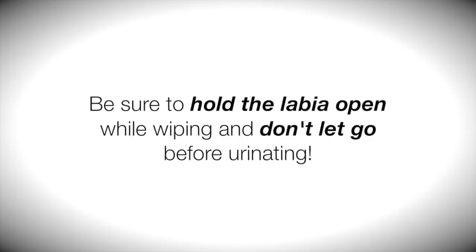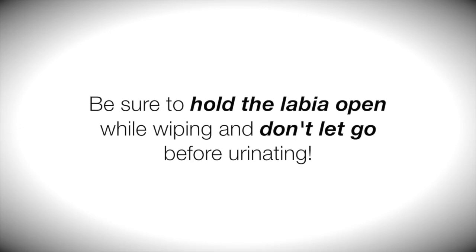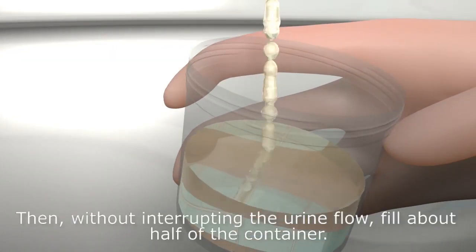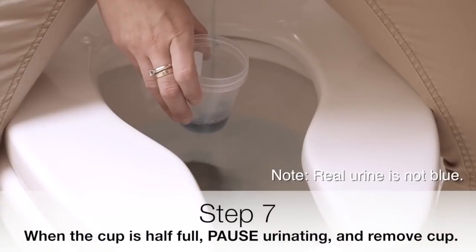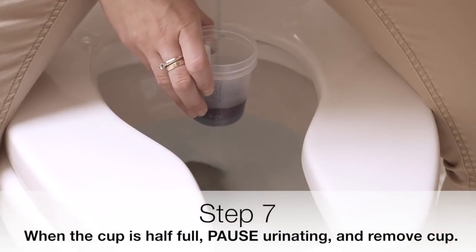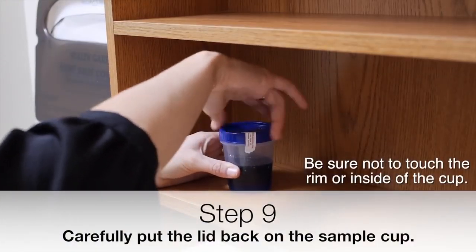3. Begin urinating with skin folds held apart with fingers. 4. Collect the midstream urine, making sure to avoid touching the skin area. 5. Fill half of the container and remove from the stream. 6. Cover the container and screw the lid tightly.